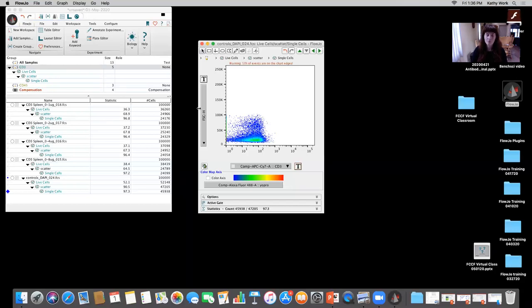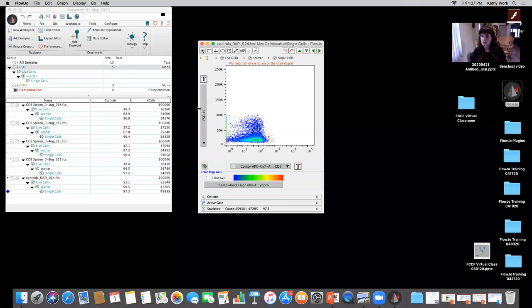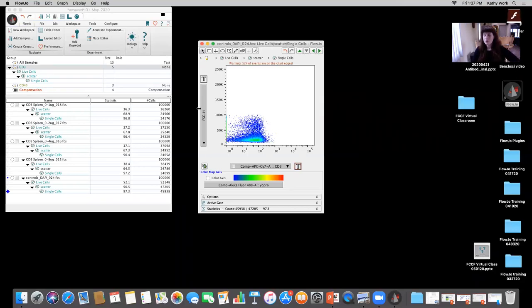Yeah, and in terms of the value, I think what this person means is, let's say on the scale, if it's the value 256 on the x-axis, is that high for forward scatter or low for forward scatter? And I guess the answer is no. It's a relative scale, so you can actually increase the gains and put the scatter wherever you want. So there's not going to be a value that you use as a discriminator for whether you have a very high scatter or not.